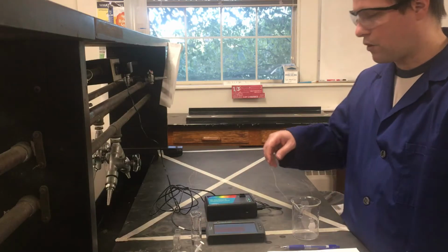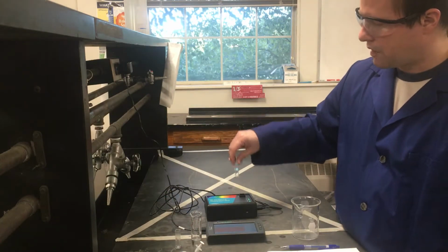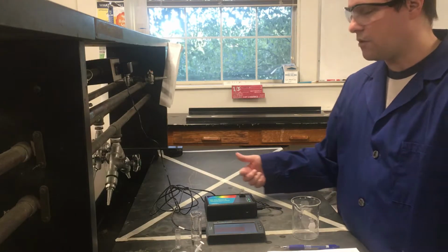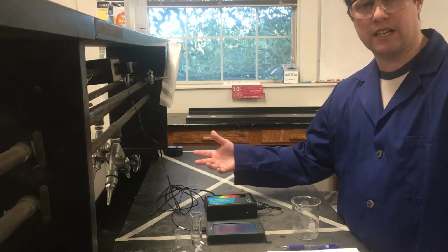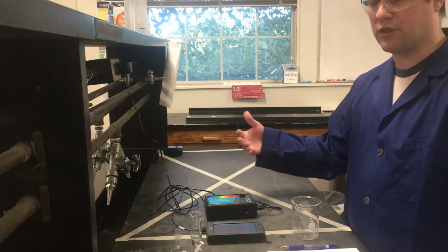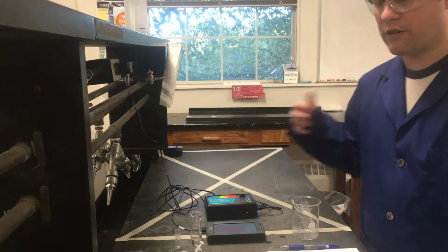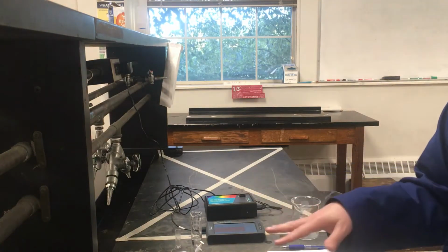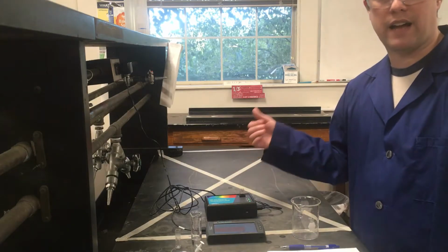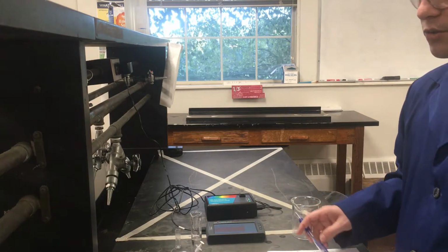The way this works is we take a little cuvette, and this one just has water in it right now. We can put our cuvette in here. It shines light through the cuvette and measures how much light it's shining at the beginning and how much light passes through the whole solution and gets to our detector. By measuring how much doesn't make it, we can relate that to what we call absorbance, to figure out how much light our solution is absorbing, and then eventually relate that to our concentration. The water I have over here we'll use as a blank when we get ready to do our first scans, and we'll get to that very shortly.